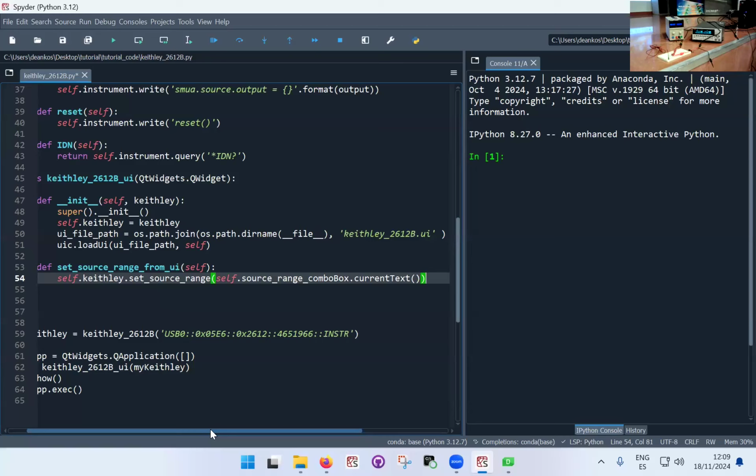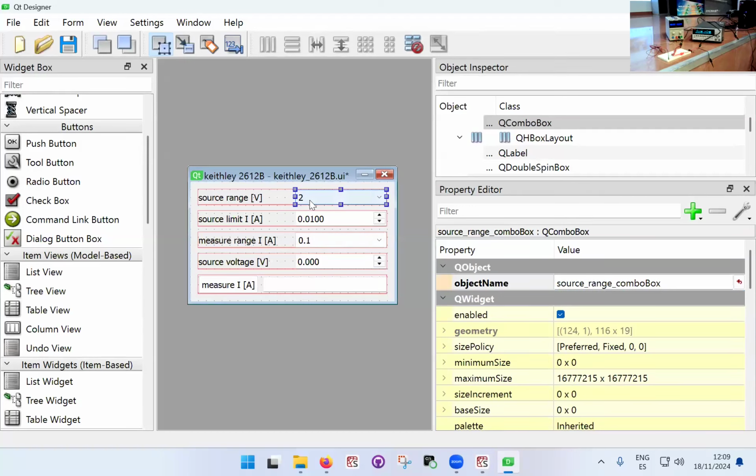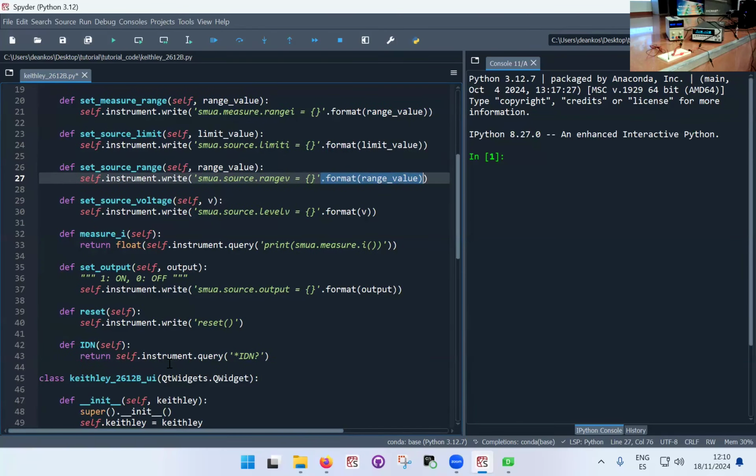So I think in this case, as long as what I'm passing makes sense, it will work. The combo box itself is not specifically a number format, it will be a string. What you have to think about is what is the Keithley going to see, right? It's going to see the result of this. So current text is going to return a number in string format, so it's just a piece of string. That string, when I call the set source range function, is going to replace these two brackets. So what the Keithley is going to see is SMUA.source range v equals whatever I put here. So it has to be a string, basically. And this dot format command in Python takes care of formatting a number into a string. So the Keithley will always see a string coming its way.